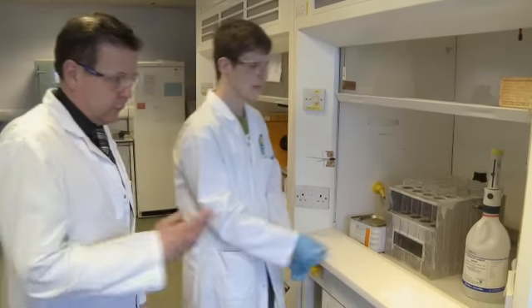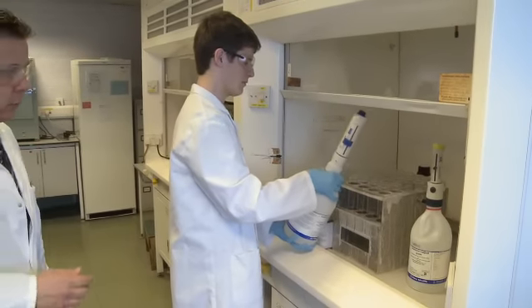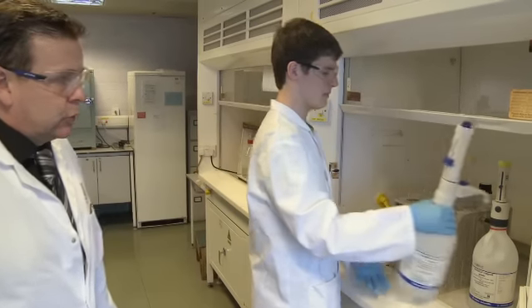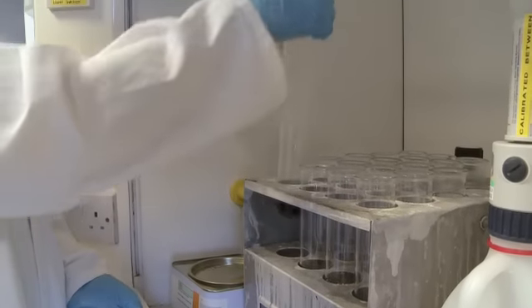We will now also add sulfuric acid and hydrogen peroxide. These are all added before the sample is put on the digestion stage, during which time it will be heated and the proteins within the meat product get reduced to the ammonium salts, allowing for easier later determination.